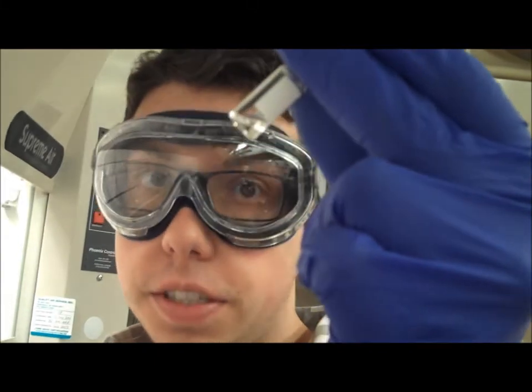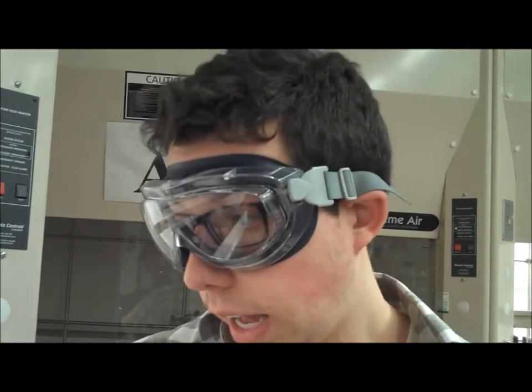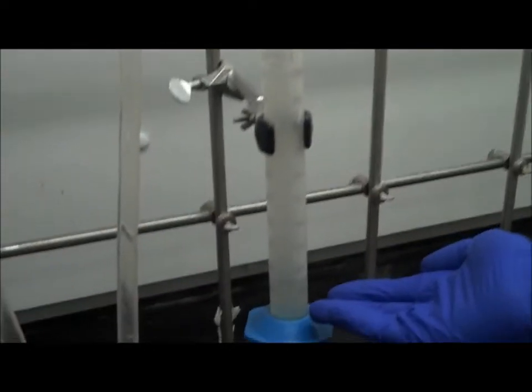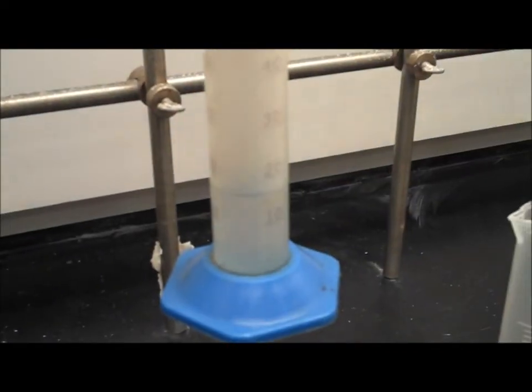Here you can see some of our sample distillate. Just a reminder, the important things to consider during this experiment are the volume and temperature of the distillate. As you reach a certain volume in your graduated cylinder, you should note the temperature at that point.